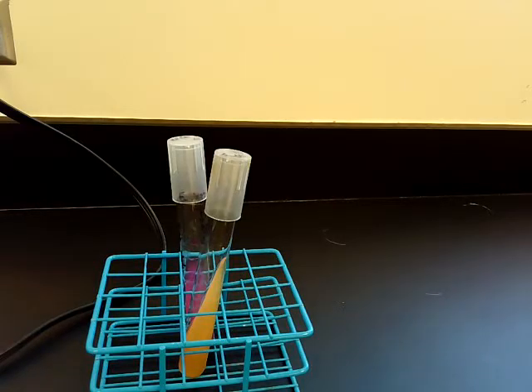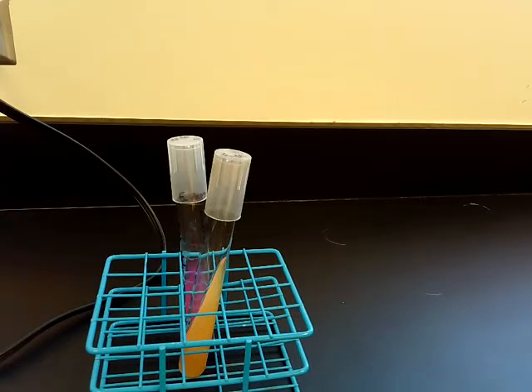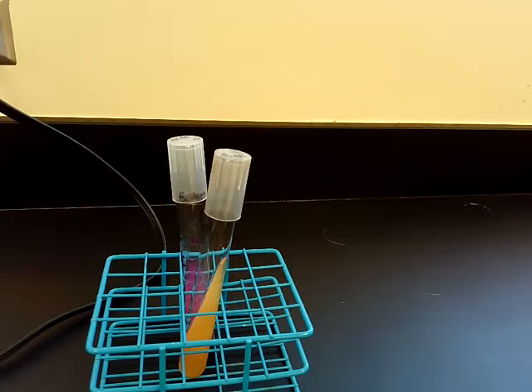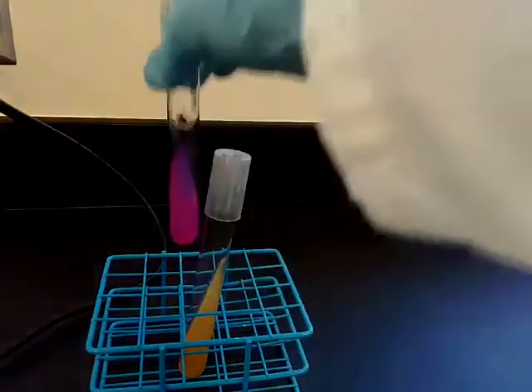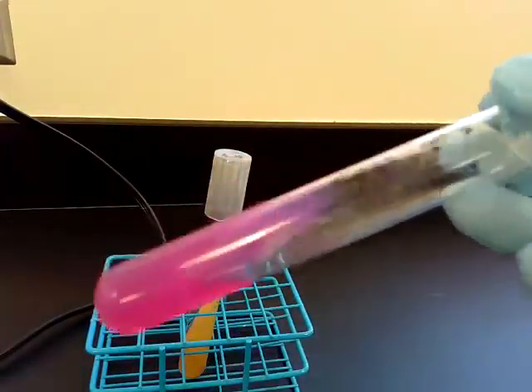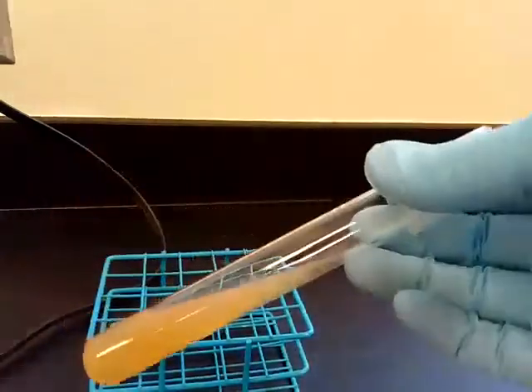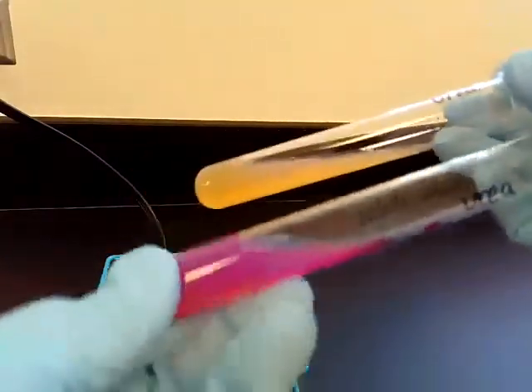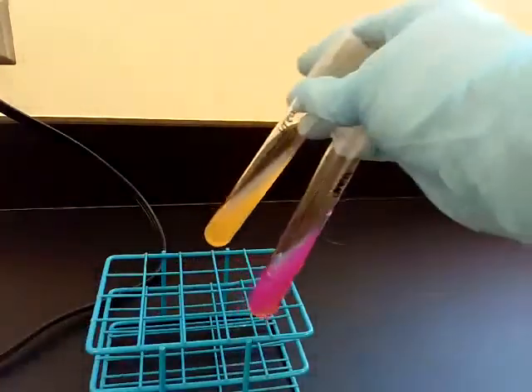For the results: the starch and casein test results are difficult to see on video, so pictures of those will be posted separately. The urea result is pretty obvious — when urea is utilized it produces a base, and you can see this hot pink color as a positive result. Comparing to the un-inoculated tube, which is our negative control, you can clearly see the bright pink color produced in the positive result.